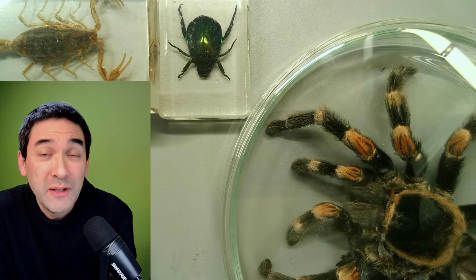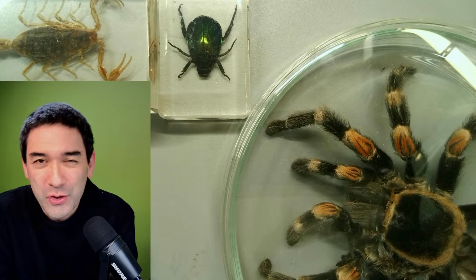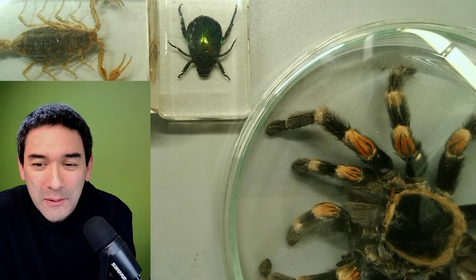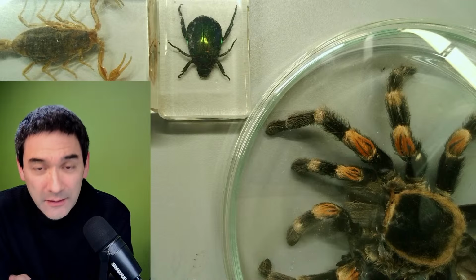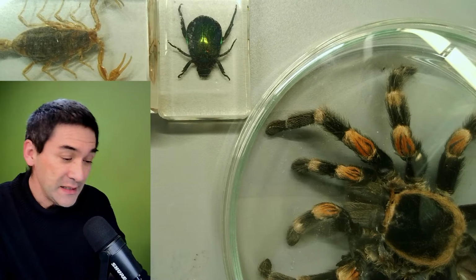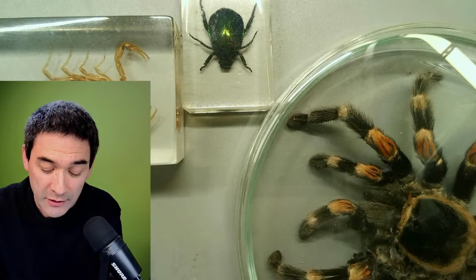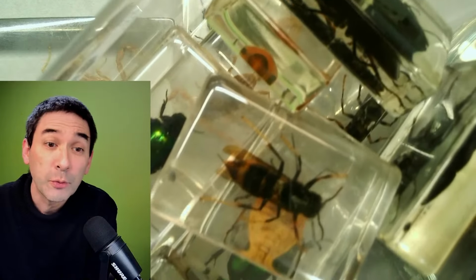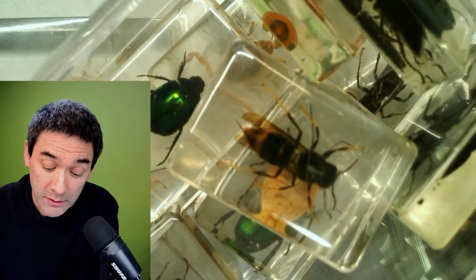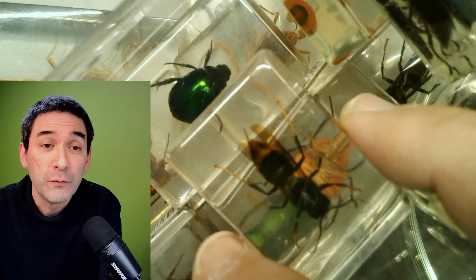Today I decided to dedicate a few minutes to stereomicroscopy. Of course, also a little bit of compound microscopy like every week, but I thought, why not a little bit of stereomicroscopy as well? Specifically, I've got several insects here, which are embedded in resin. Not the spider here, I will talk about this one later. But I have a whole box of insects. I did not make them. These are commercially prepared insects that we're using for education.